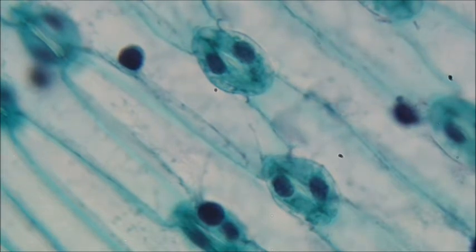Okay, the last plant I'm going to show you, I am going to make the slide myself. So you can watch me do that. Hello, year 8. So we've looked at some cells that were all pre-made slides like this. See, it says human blood. So that's what I was looking at for human blood. It wasn't my blood. And like the frog's blood, they're all pre-made slides. But for the last plant, I'm going to make the slide myself.